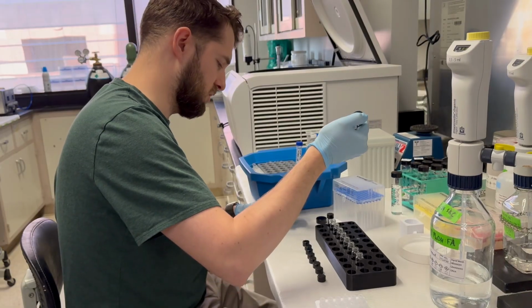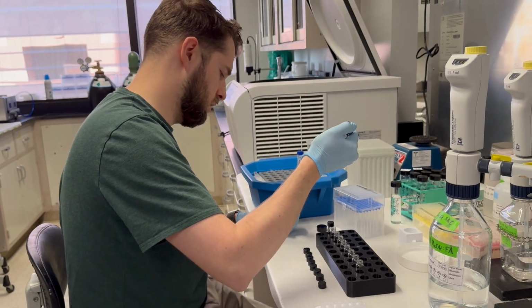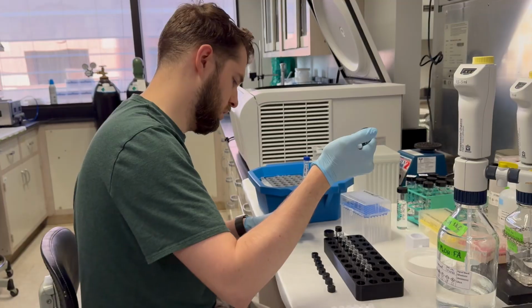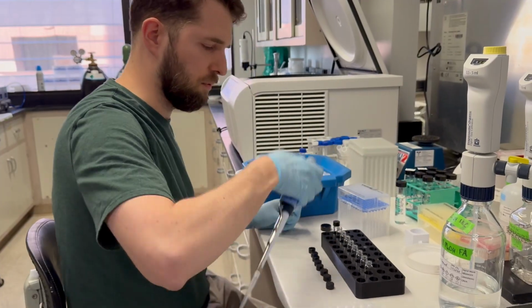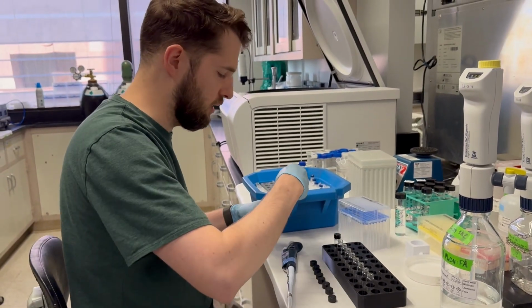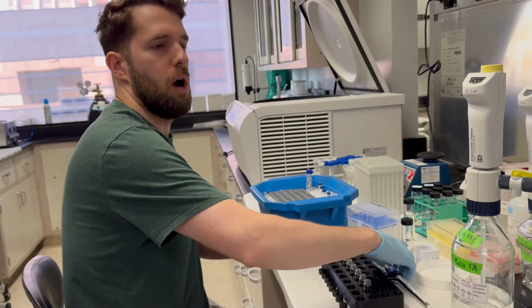And in my head, I'm just counting, just to keep myself on track where I'm at with these vials. The other thing you can do as well that is fairly straightforward is just to look down before you pipette, and you can tell an empty vial from a partially filled vial. That always works too.